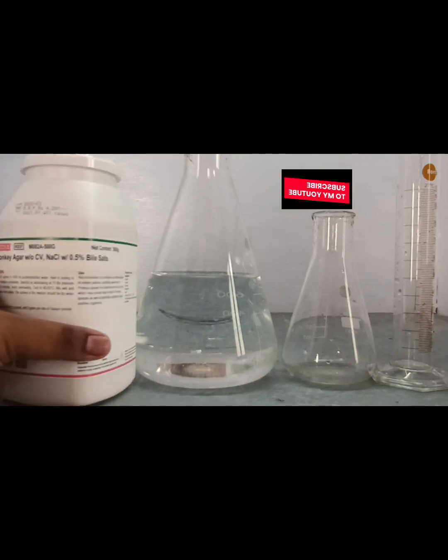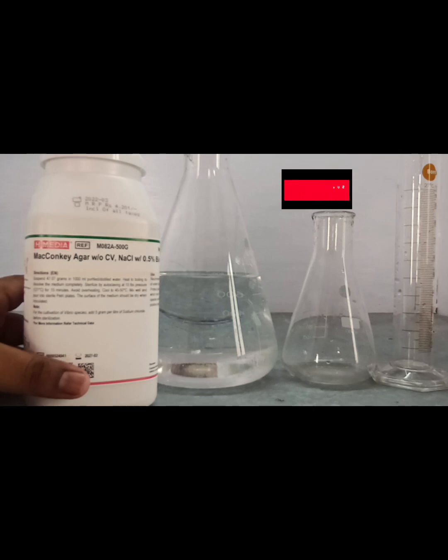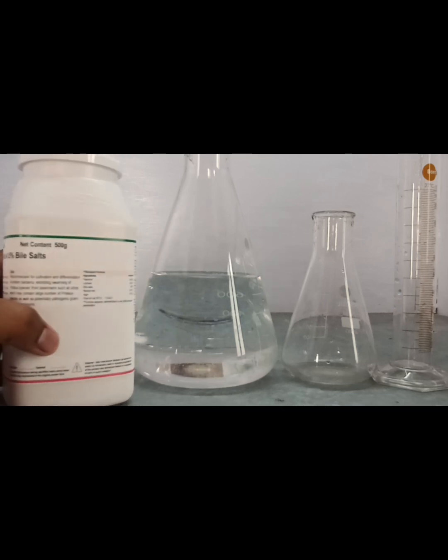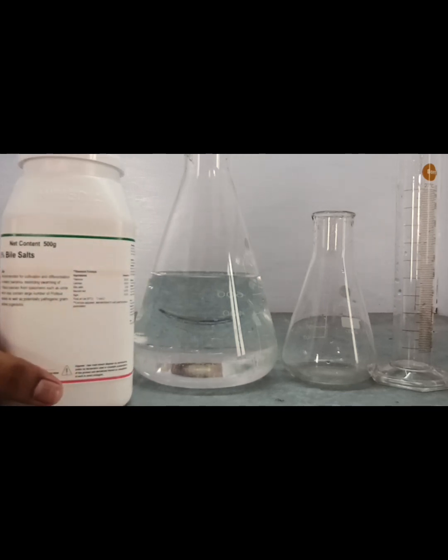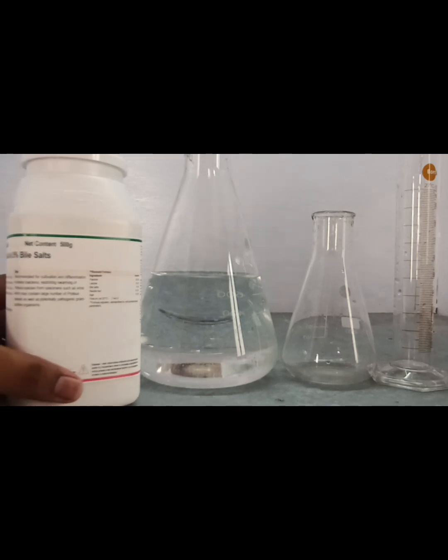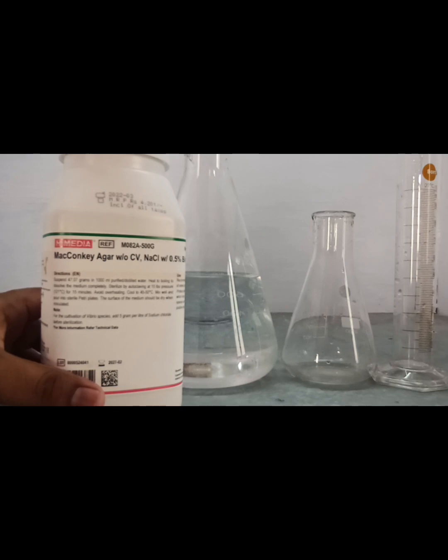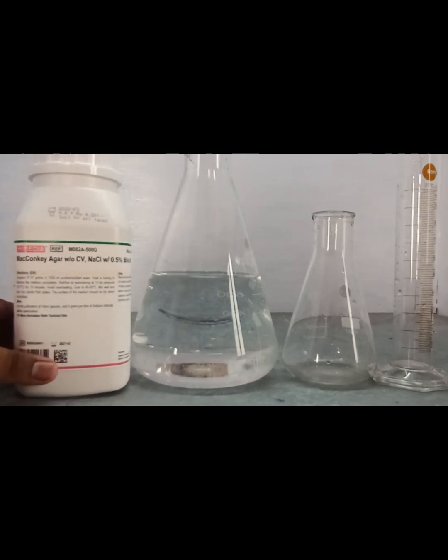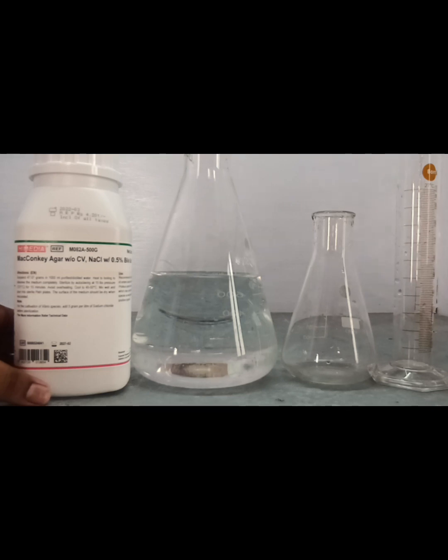What is the composition of MacConkey agar? It contains agar, peptone powder, bile salt, lactose, and the indicator is neutral red. When we prepare the agar, you see the agar is completely brick red in color.